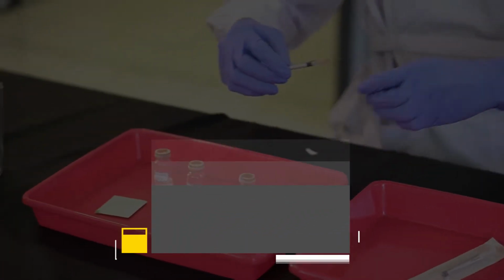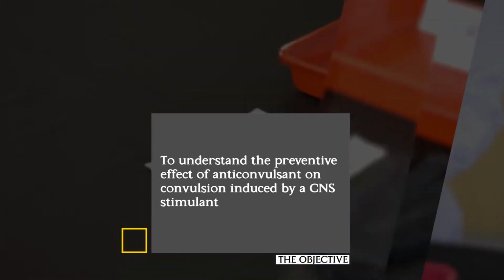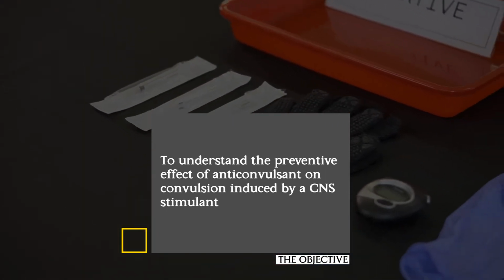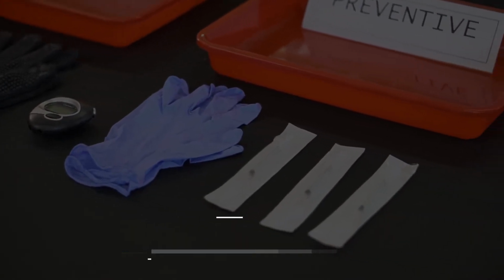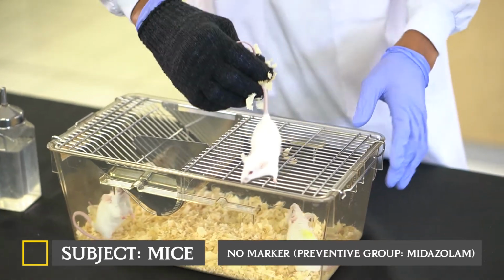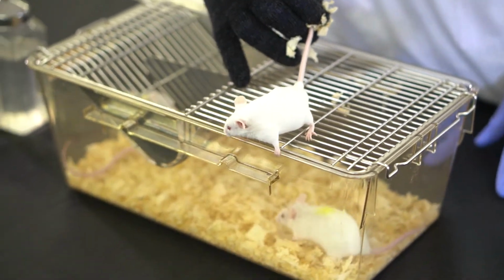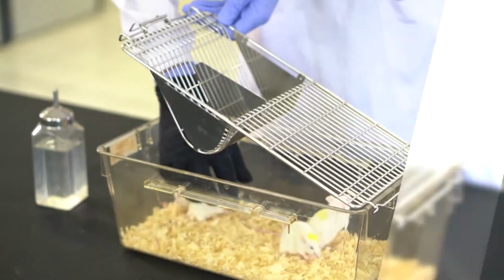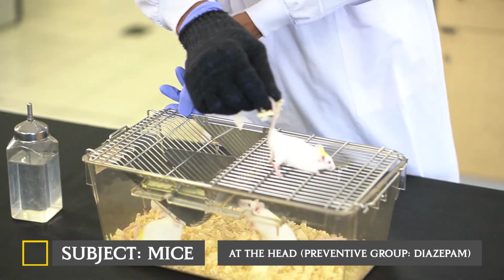By conducting the experiment in video part 1, we will understand the preventive effect of anticonvulsants on convulsion induced by a central nervous system stimulant. Mice without marker: preventive group midazolam. Mice with marker at the head: preventive group diazepam.